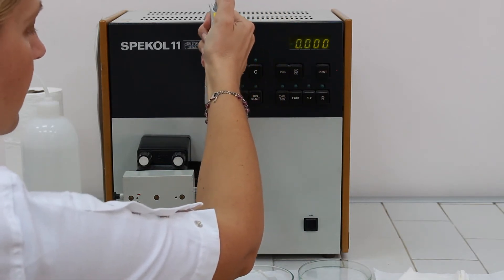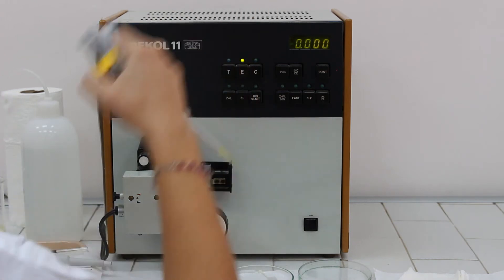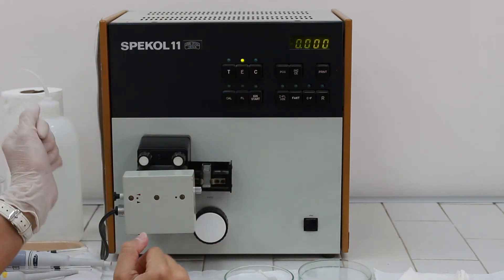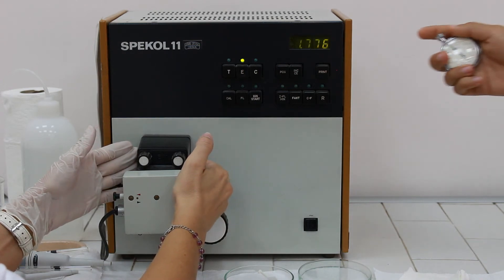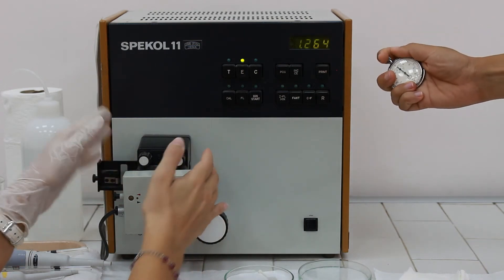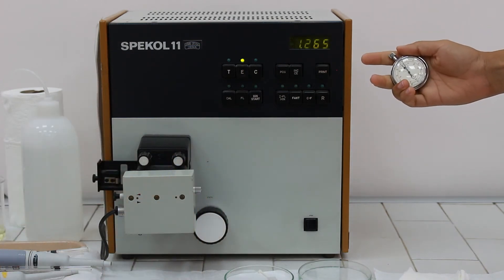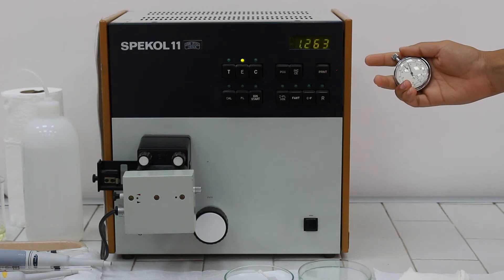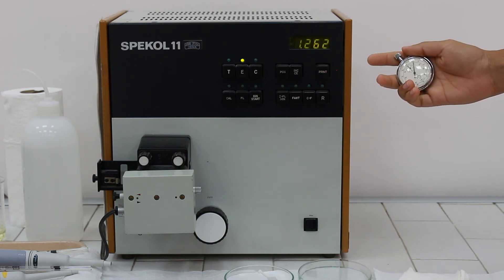Working wavelength is 340nm and now we need to start measuring absorbances. Read the absorbances for 3 minutes, each minute.